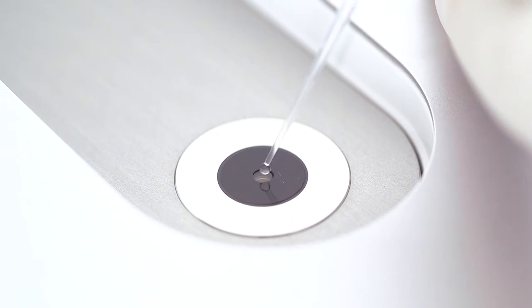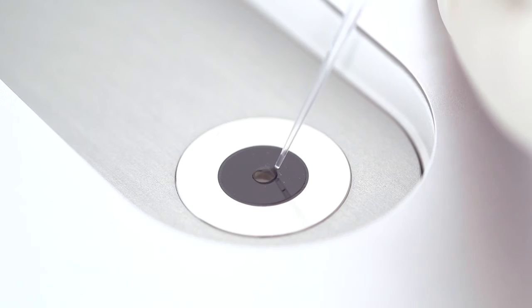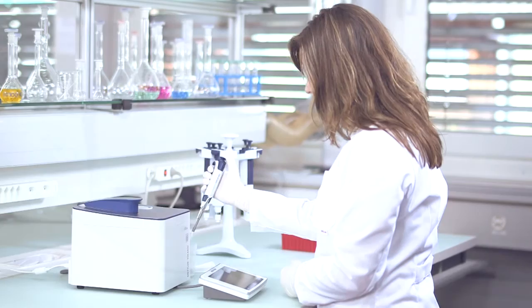To begin, pipette one microliter of sample solution onto the measurement platform. The platform can be easily accessed from either the right or the left side of the instrument.